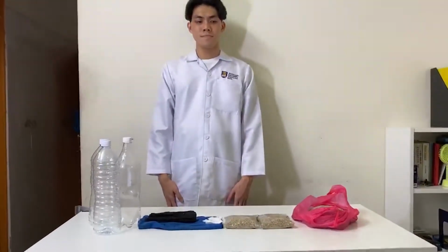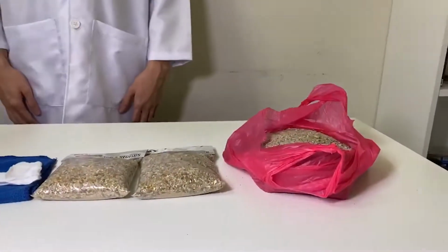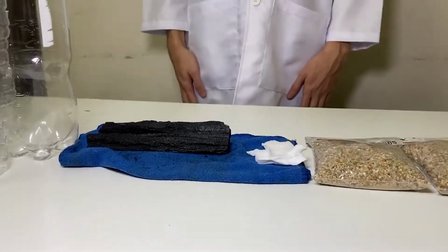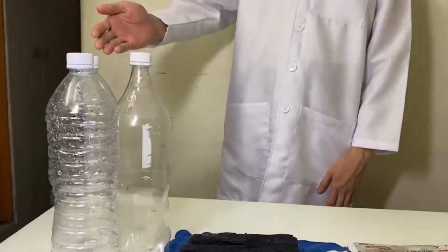Hi, this is the apparatus for the natural resources water filtration system. First is the sand, next is the small stones, cotton pad, charcoal, and a few bottles.